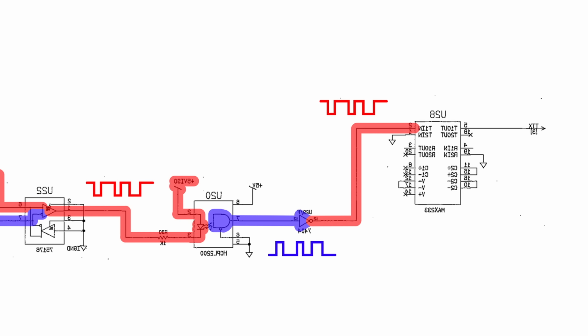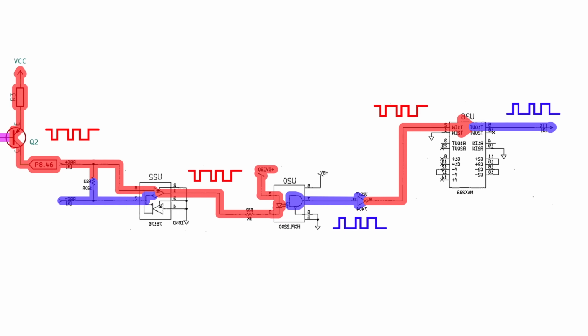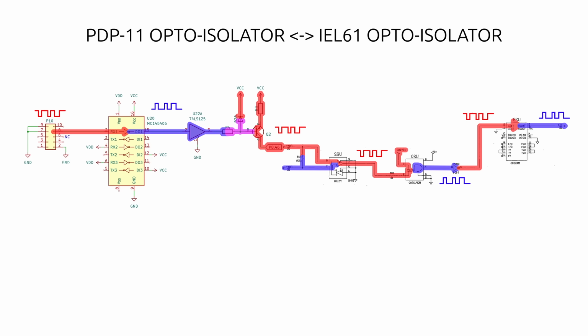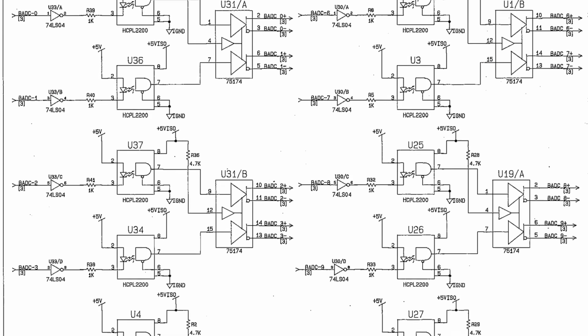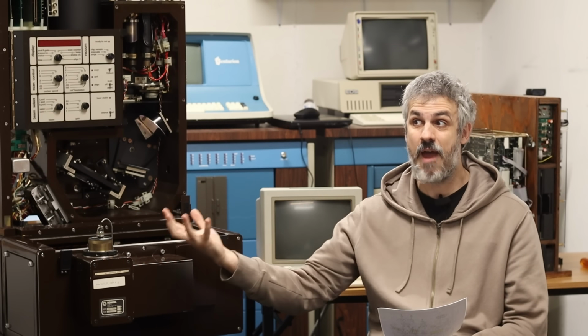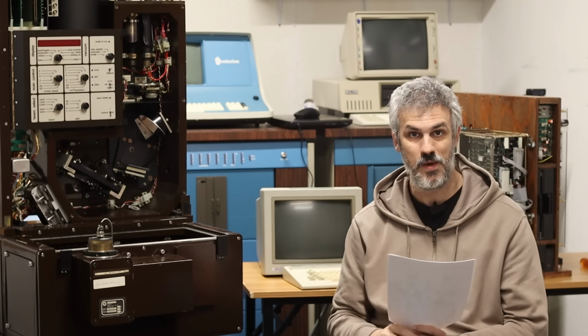And then they have a 7404 that inverts that opto-isolator output signal, and that gets fed into a MAX 233 that level shifts it to RS-232, but the MAX 233 inverts it yet again. And so the RS-232 levels going into the Bomem are perfectly inverted from what the PDP-11 is sending to it. Now, I haven't gone through and checked, but it's entirely possible that all of the ADC signals and everything else that's going through this entire chain is also going to have this same inversion problem. And it may just end up being that everything is backwards between the two.